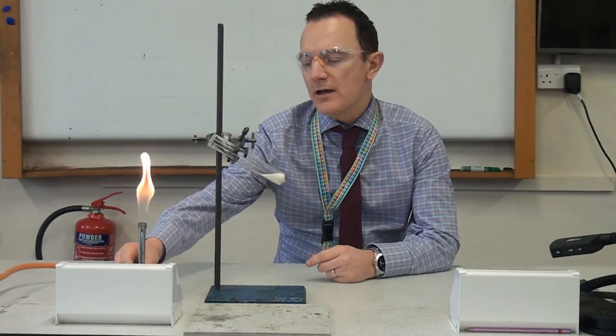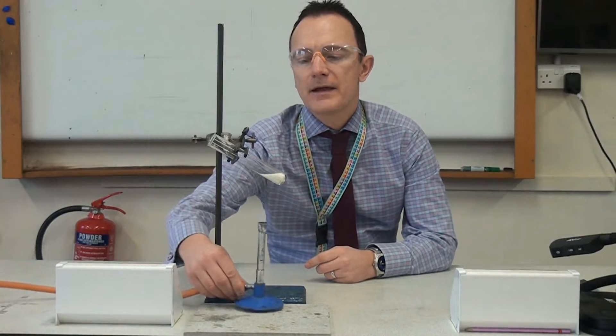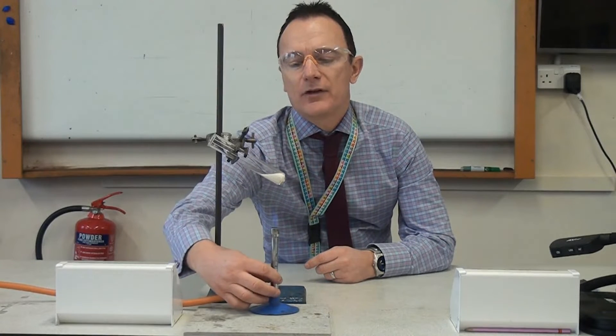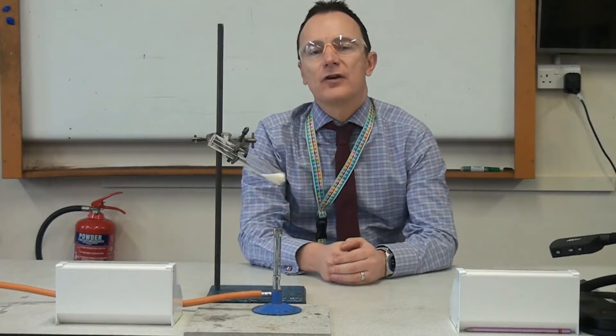So first of all I've got some sugar in this test tube and I'm going to start heating it up with the Bunsen burner to see how easy it is to melt the sugar and we're going to come back to that in literally a minute or two's time.